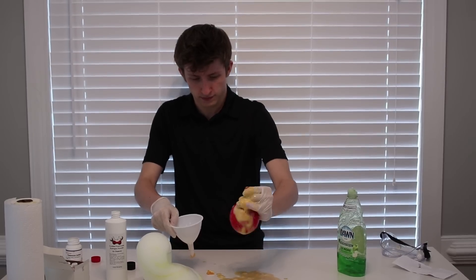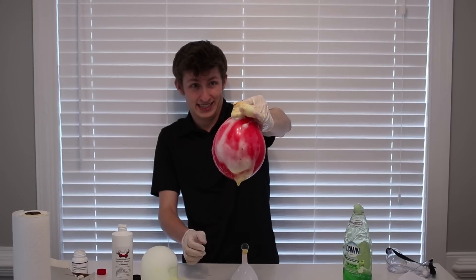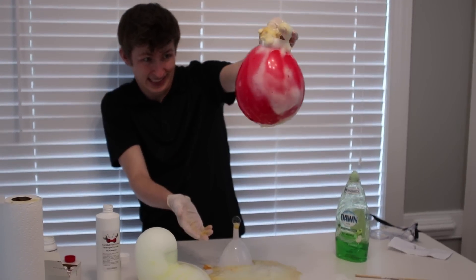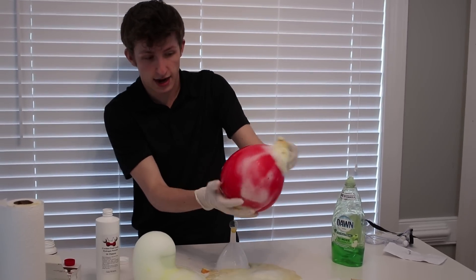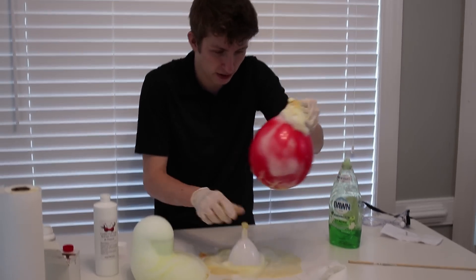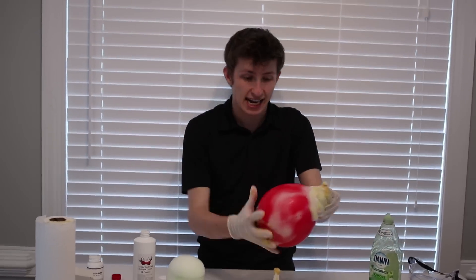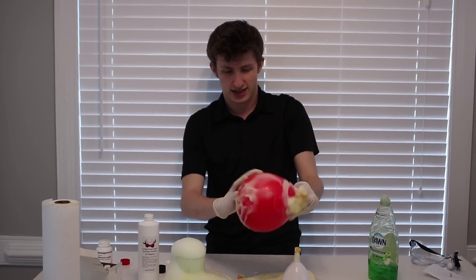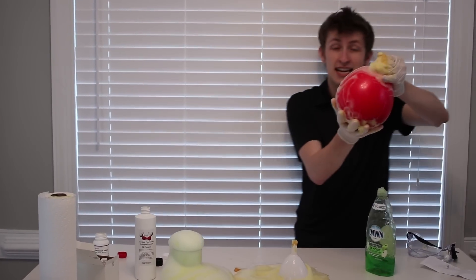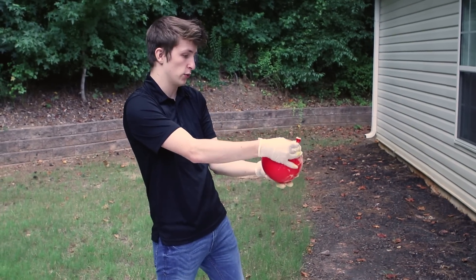It's steaming up. Yikes. This is so hot. I literally just... It's just all foam. Look at it, look at how much, like, it just exploded here. This balloon is so hot. It's literally staining my latex gloves, guys. Look at this. It's literally just a foamy balloon now. Here, let's take this outside, guys, and let's see what happens when we open it up. All right, guys, so let's just see what's in the balloon now. I'm assuming it's just going to be filled with just foam.